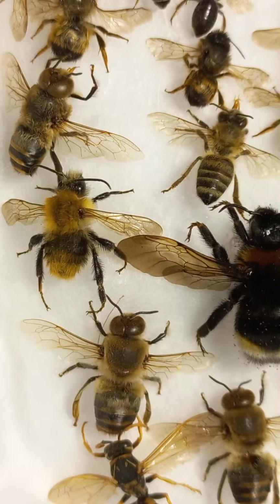If the antennae are cut off, the honeybee will not be able to negotiate with another honeybee inside or outside the colony and will be unable to make comb and will very soon die. Once odor or other tactile stimulation are detected, signals are transmitted down the nerve cord to the brain of the honeybee. There are about 3,000 plate organs on each antenna of the queen, and 3,600 or 6,000 in the worker honeybee.